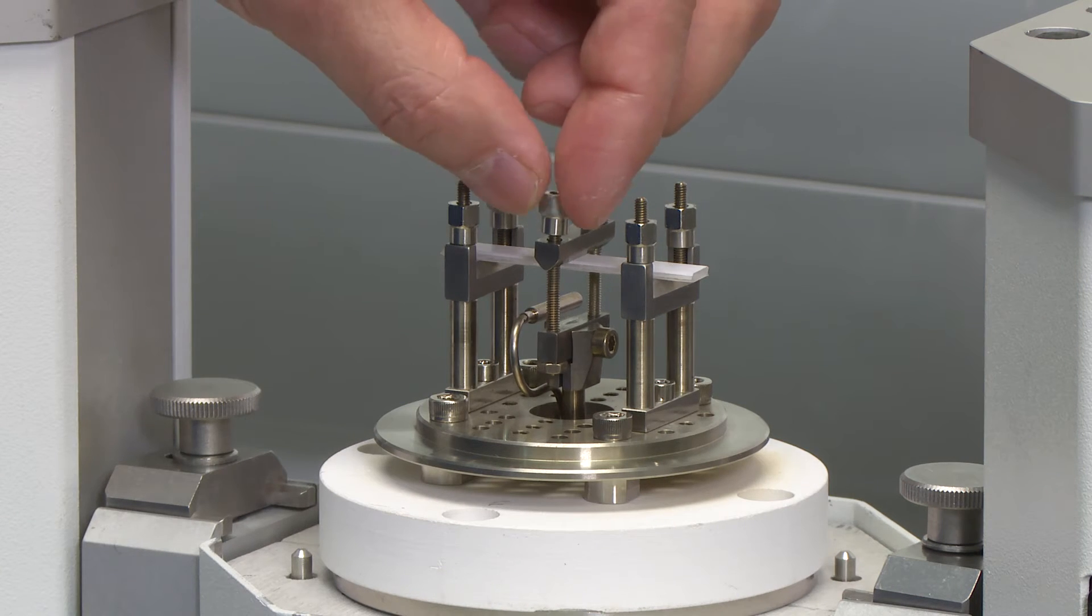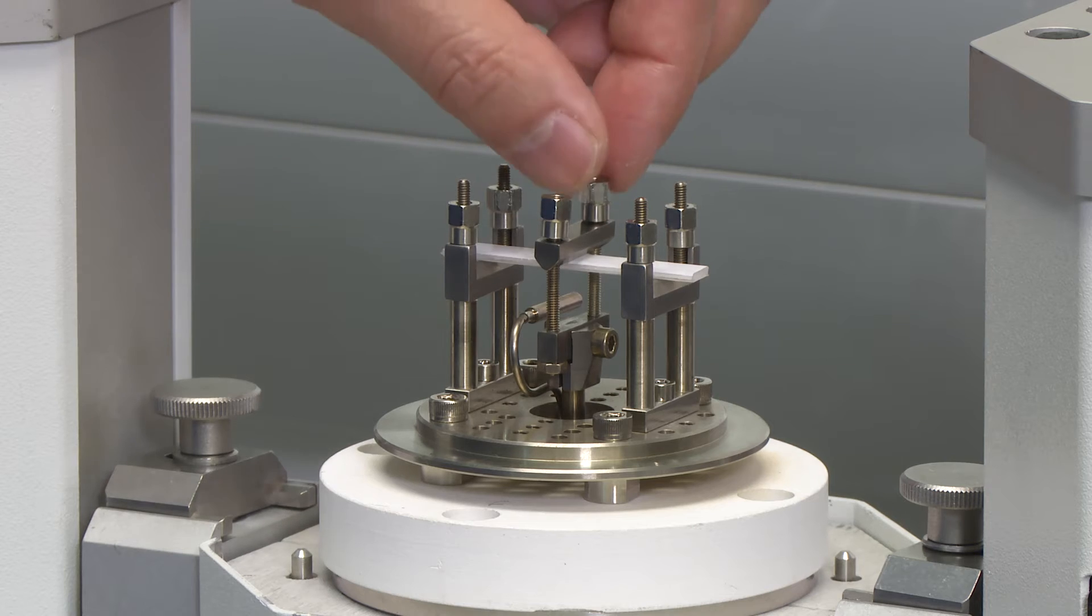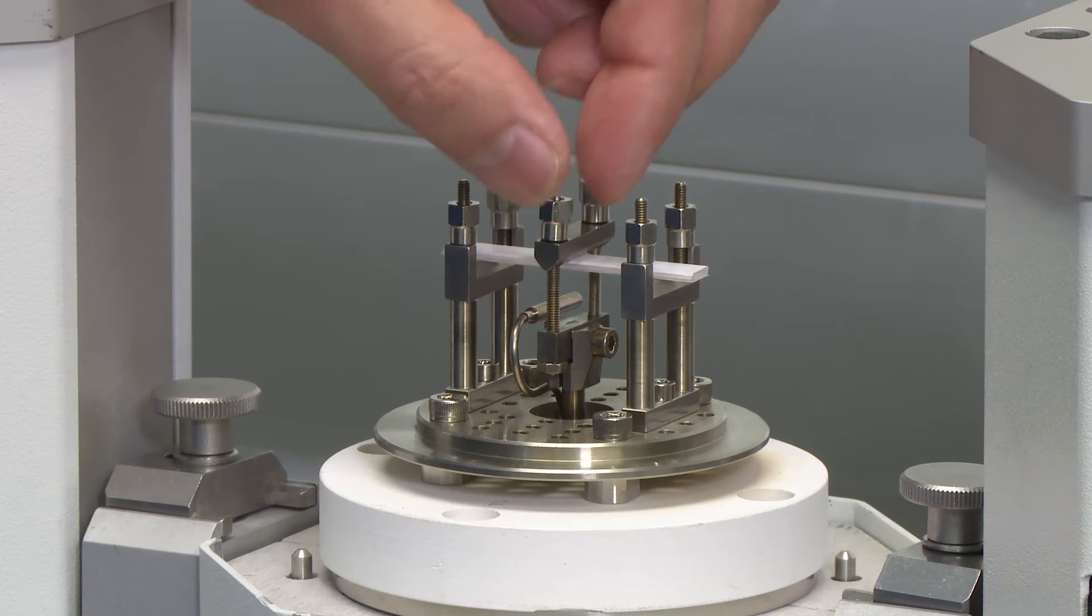Tighten these two nuts. Make sure they're barely touching the center knife.